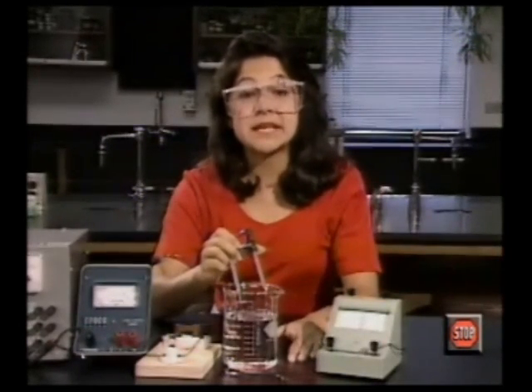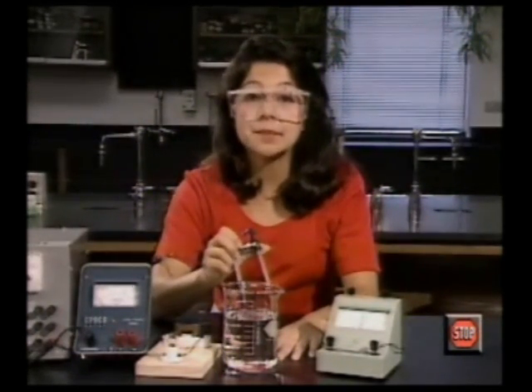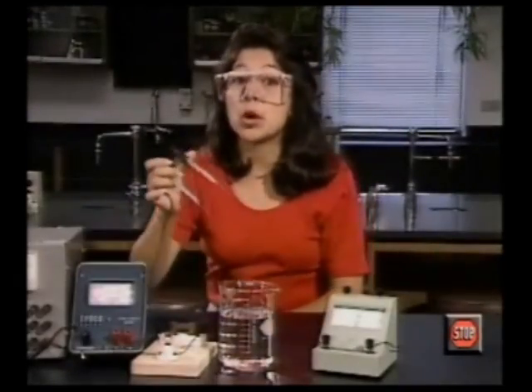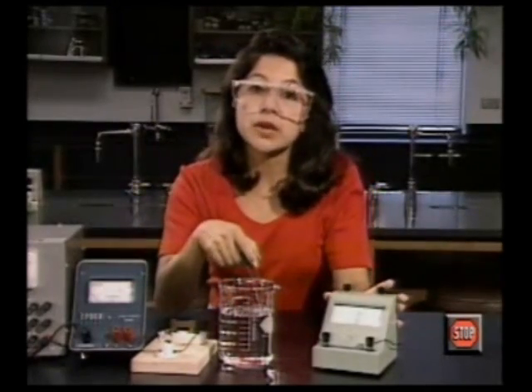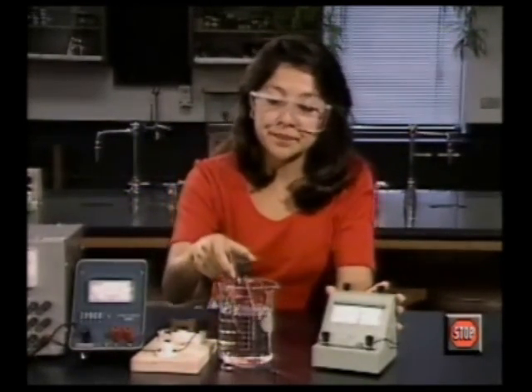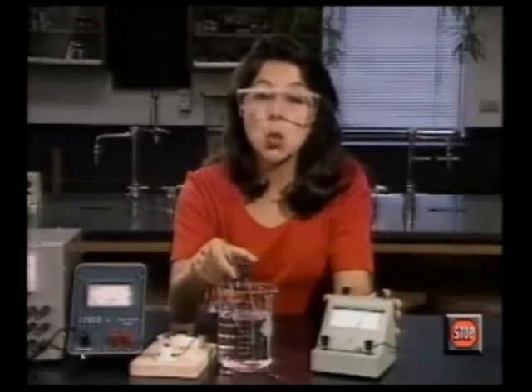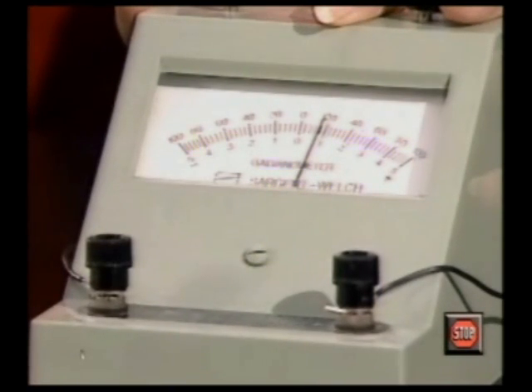Pure water may seem to be an inactive compound, but there's chemical activity going on in water all the time. You've seen that pure water cannot conduct enough electricity to light this bulb. But watch. This is an extremely sensitive device capable of measuring a very small current. The degree of conductivity is extremely small, but pure water does conduct electricity. There are ions in the water.